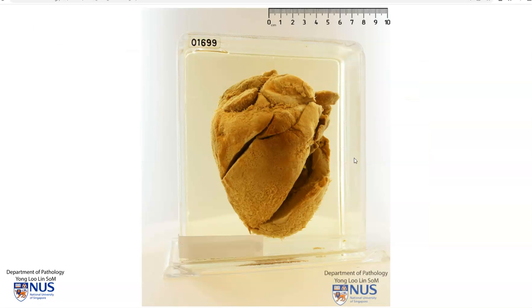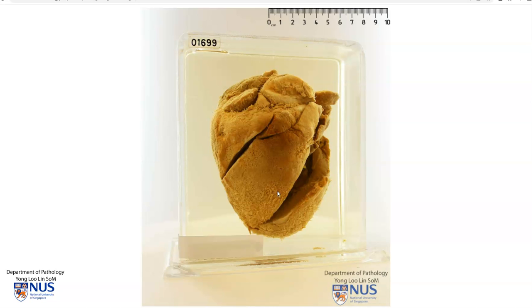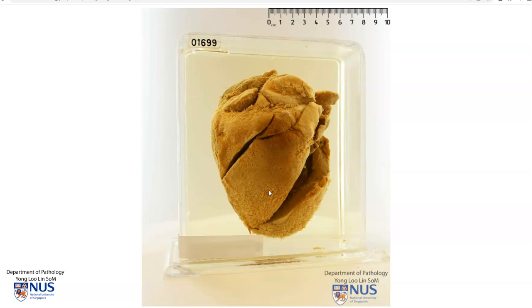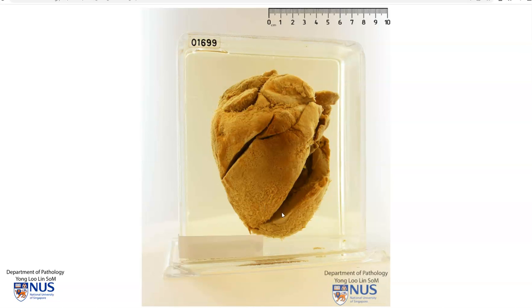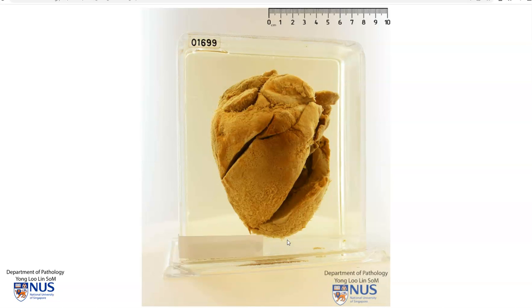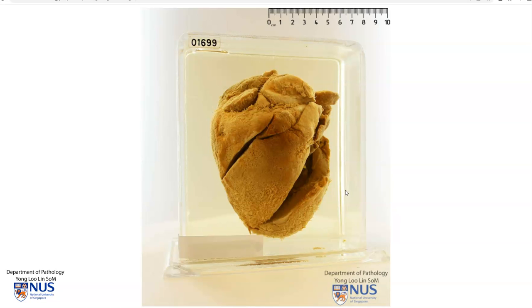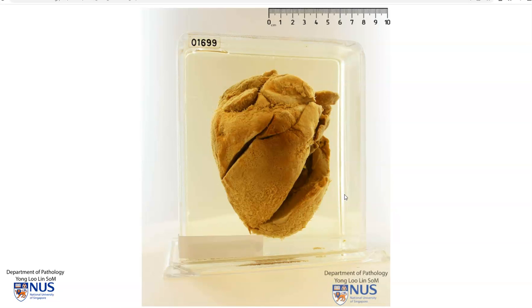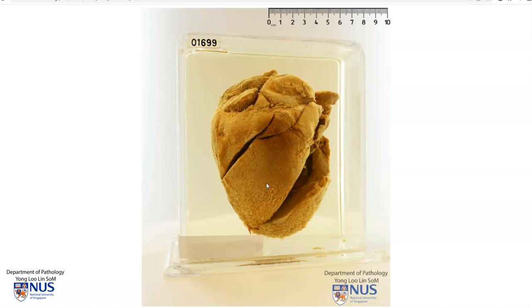In summary, this is an example of fibrinous pericarditis where you can see this very roughened, shaggy appearance of the epicardial surface or the visceral pericardium of the heart. For this particular specimen, the parietal pericardium has been stripped off, so we are only looking at the surface of the visceral pericardium. This is due to inflammation and it can be seen in various immune-mediated conditions. Thank you.